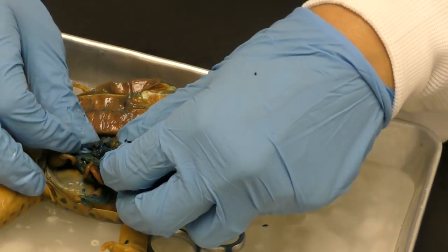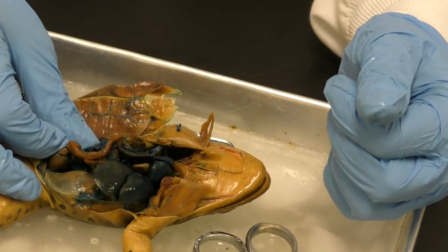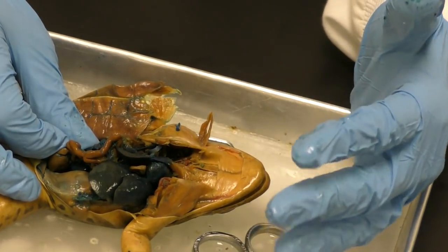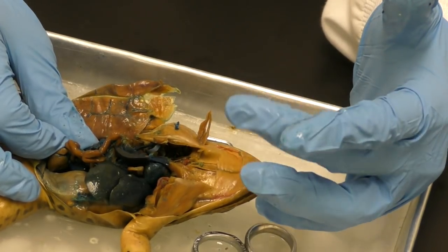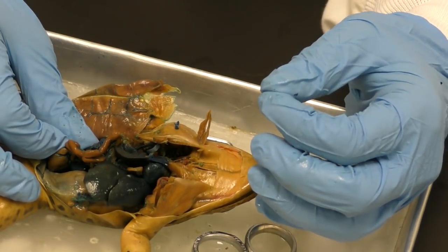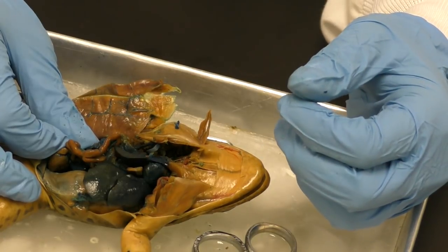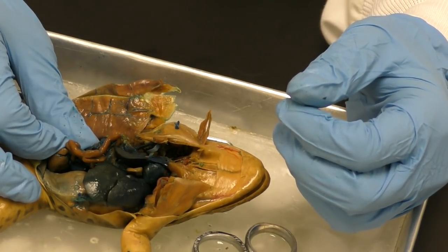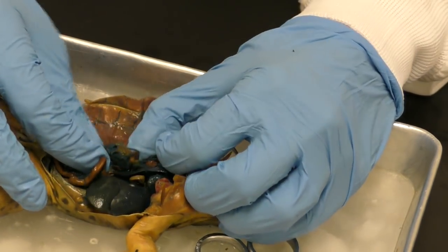The cool thing about frogs, and you know what, it's true for all organisms, is they're a tiny bit different inside. The map is the same, but the size, the amount are all a tiny bit different, which makes being a doctor quite an amazing feat because every human has a little bit different stuff going on with them. And potentially this frog, if it were a female, already laid its eggs.